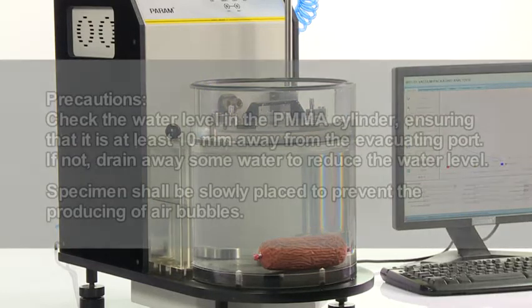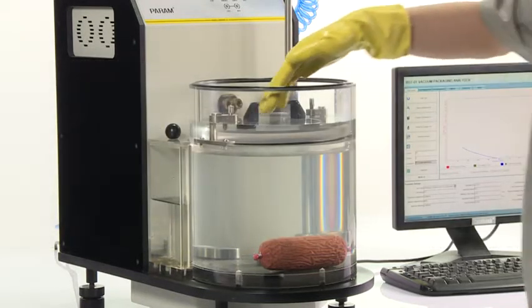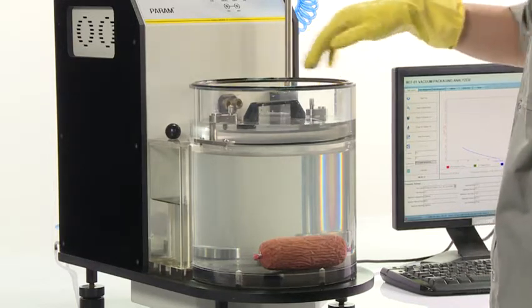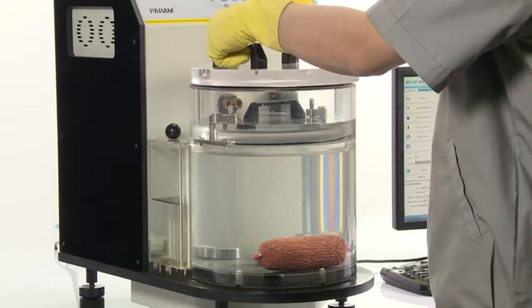Precautions: check the water level in PMMA cylinder, ensuring that it is at least 10 mm away from the evacuating port. If not, drain away some water to reduce the water level. Specimen should be slowly placed to prevent the producing of air bubbles. Place the exterior lid properly in position.